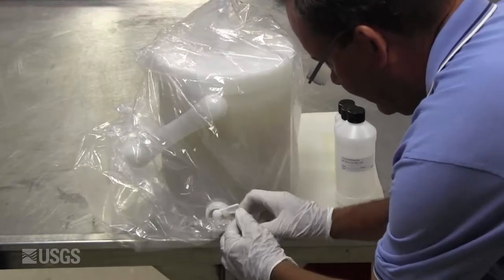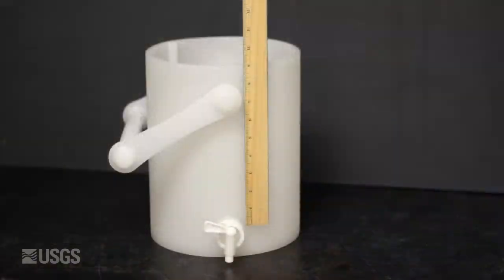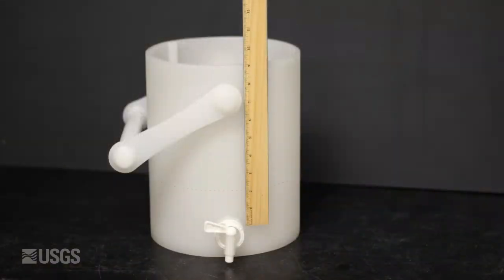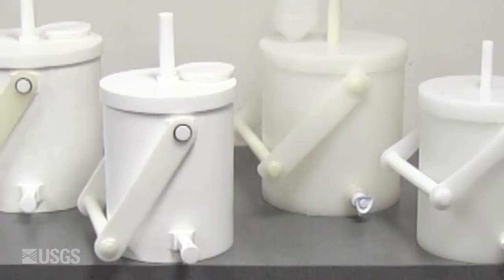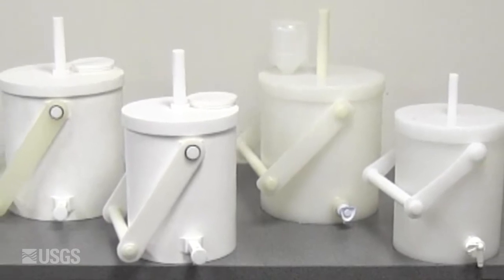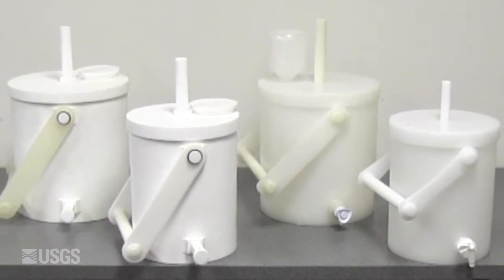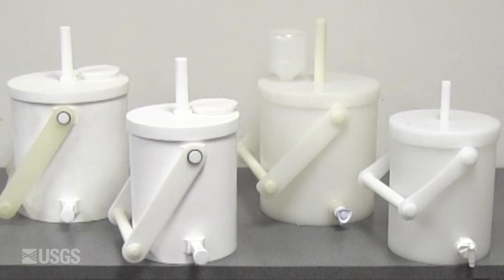After all samples are withdrawn from the churn, the water level inside the churn should be at least 2 inches above the spigot inlet. Churns are not approved for some microbiology sample processing. See Chapter 7 of the National Field Manual for additional details.